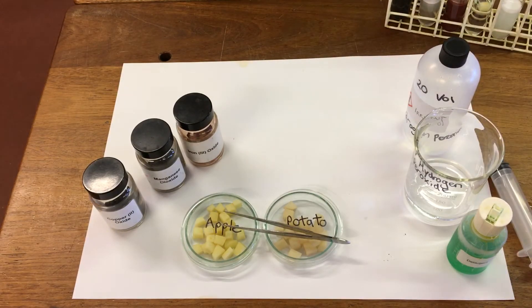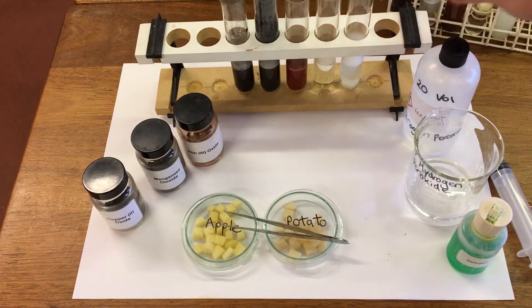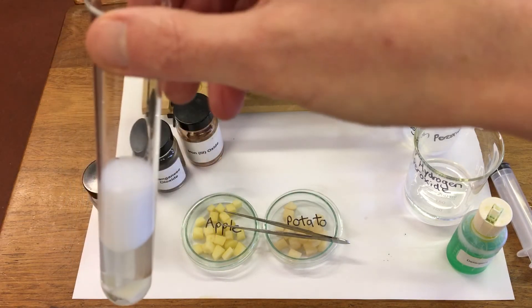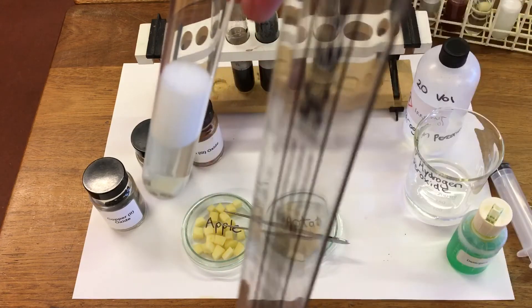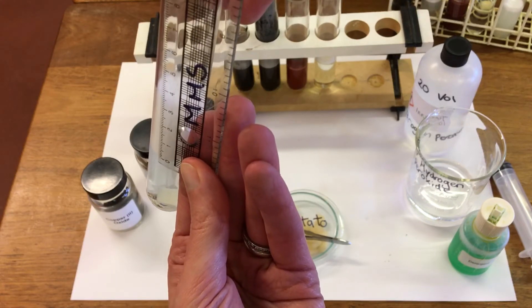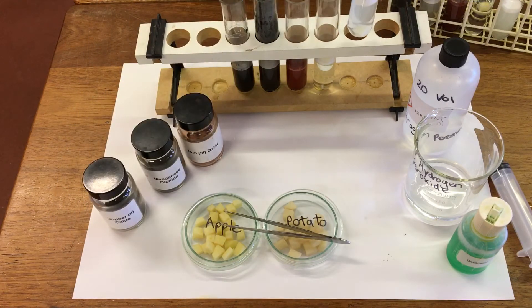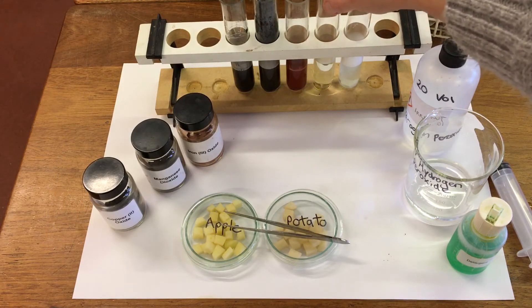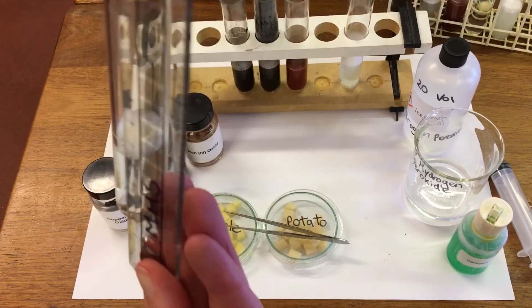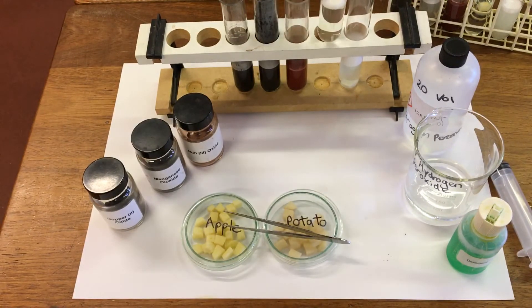I've got one here that's been left for five minutes. Our first test tube is the potato — we have 3.5 centimeters of foam. The next one is the apple — after five minutes we've got 0.5 centimeters of foam in that one.